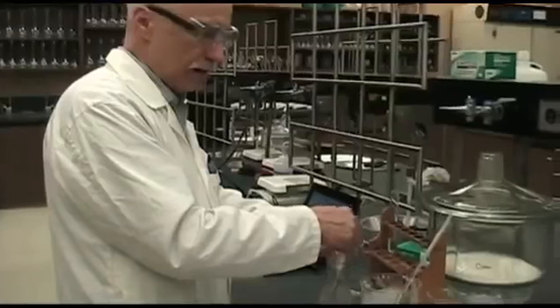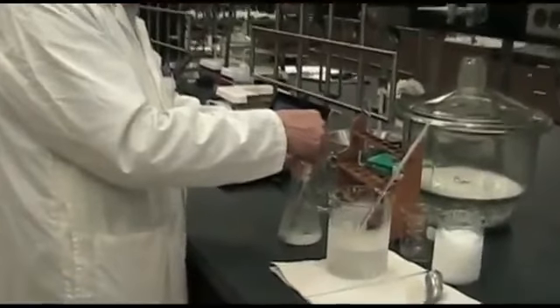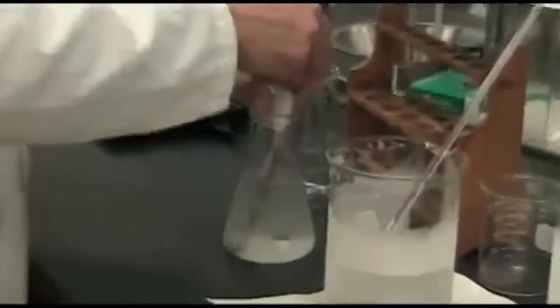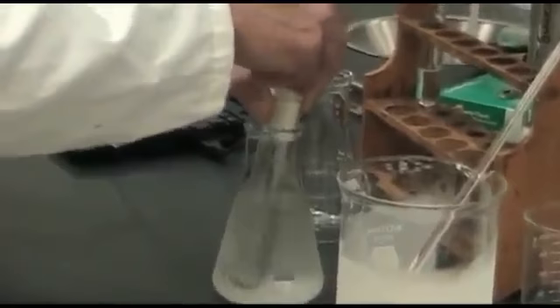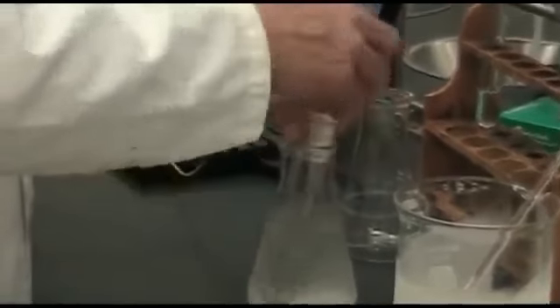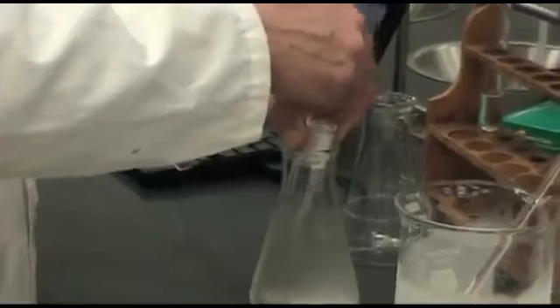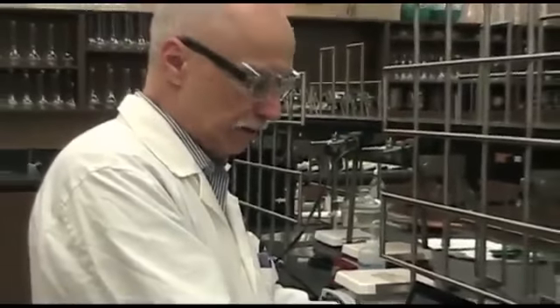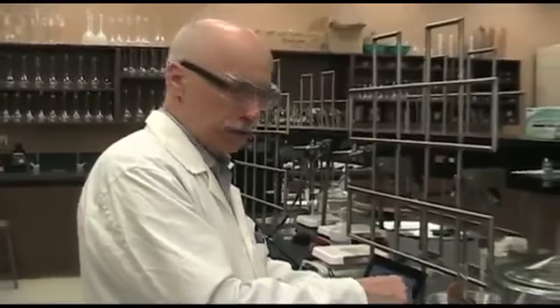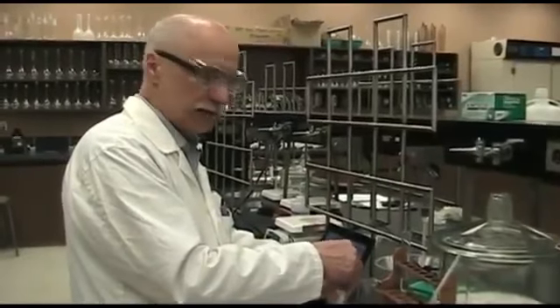So this is going to take a while, and we'll be back when this gets closer to the freezing point, when we're going to have slush in the cooling jacket. In the meantime, we'll monitor the temperature, and if we need to add any more ethanol at -40, then we'll replay that and show you what we do to maintain that at -40.